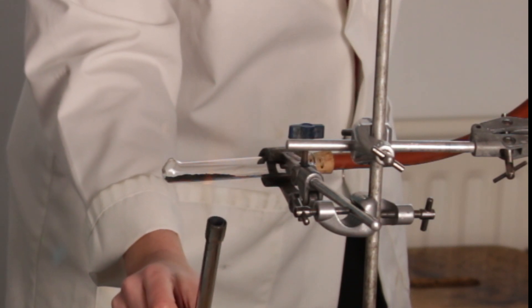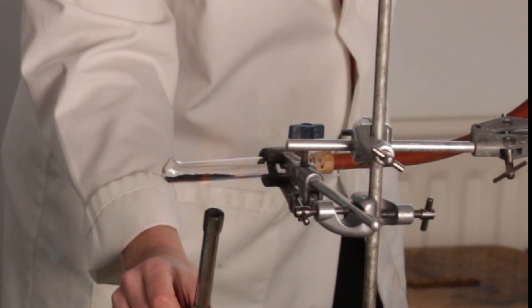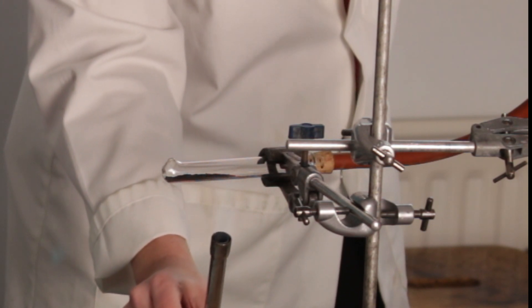We can see already towards the middle of the tube where the copper oxide is spread quite thinly. There is a colour change going on there already.